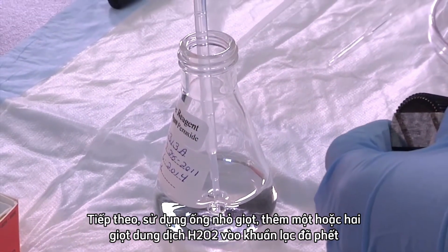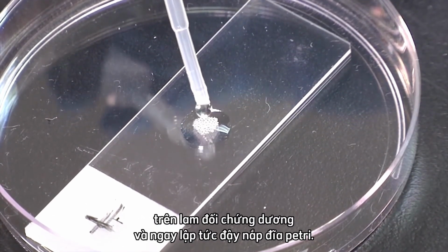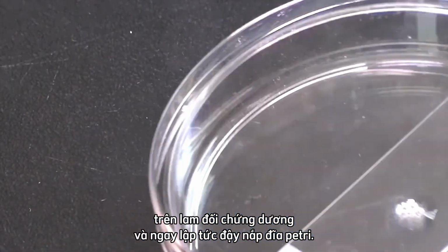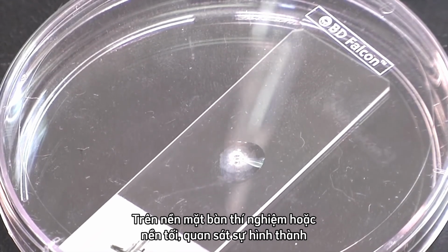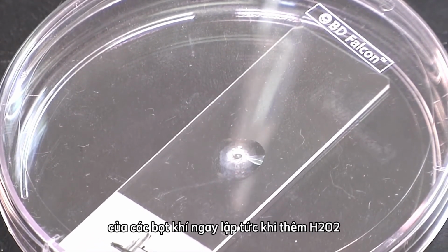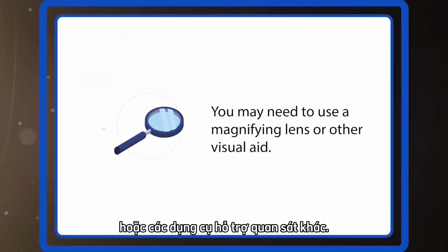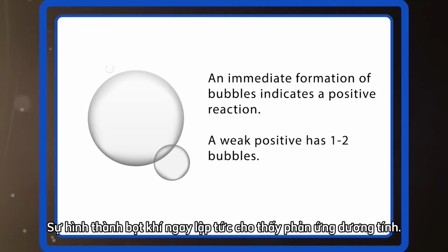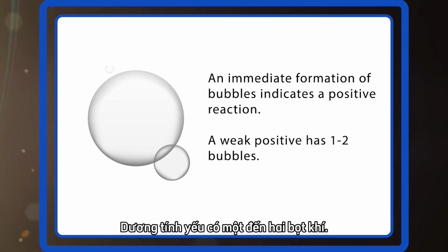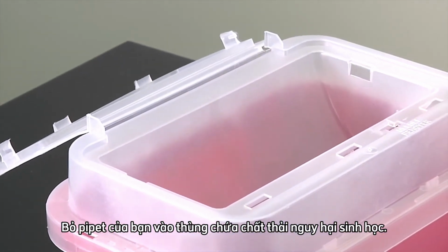Next, using a dropper, add 1 or 2 drops of H₂O₂ solution to the smeared colony on the positive control slide and immediately place the cover onto the petri dish. Against your benchtop or a dark background, look for the formation of bubbles immediately upon the addition of the H₂O₂. You may need to use a magnifying lens or other visual aid. An immediate formation of bubbles indicates a positive reaction. A weak positive has 1 to 2 bubbles. Discard your pipette into a biohazardous waste container.